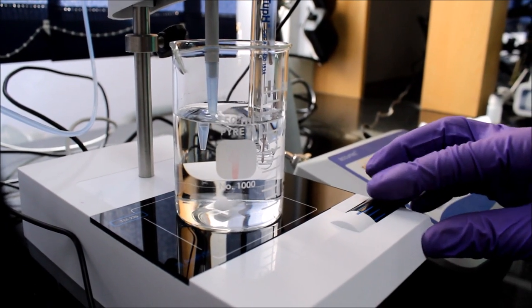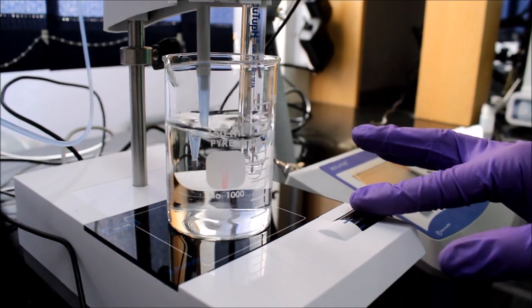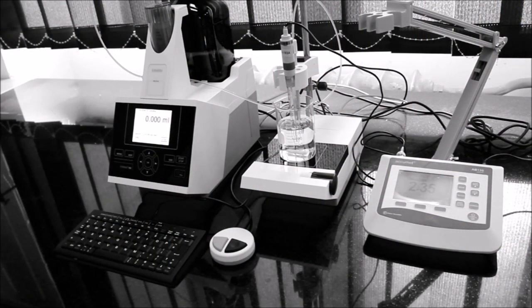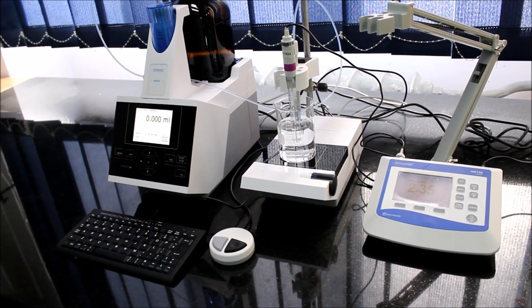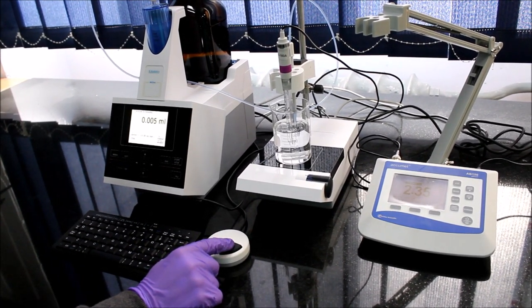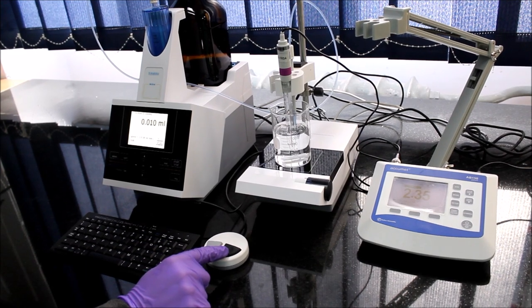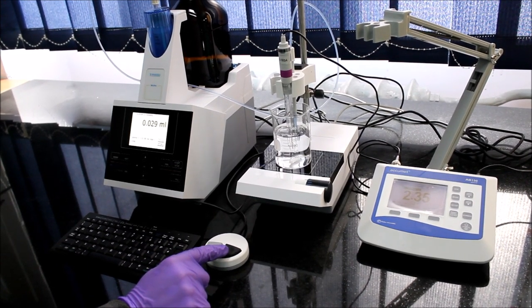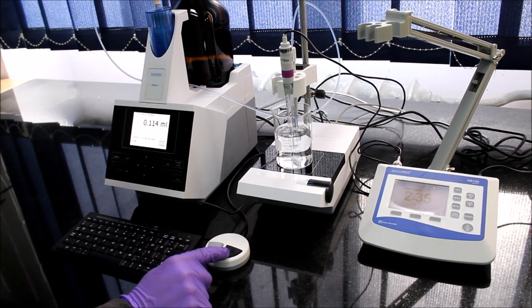The average speed is the best. OK, let's demonstrate the titration process. The magnetic stir is turned on and the titration is running. In this case, the titrant solution is acid, so when it dissolves in water, the pH should decrease.